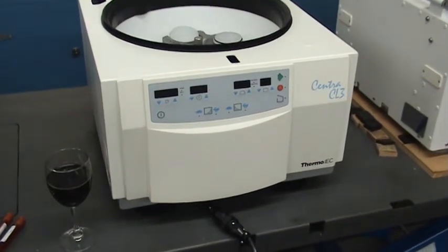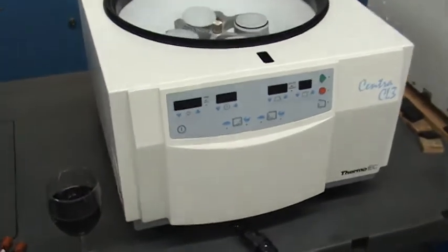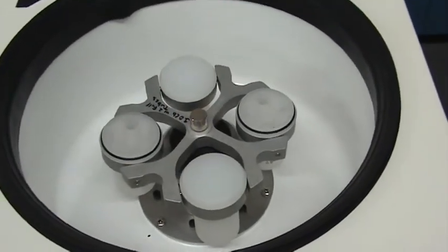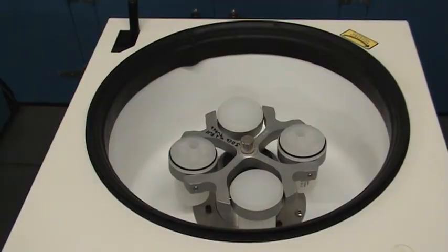For demonstration purposes, we've now installed the Rotor-Mate gyro into the thermo instrument. Some self-balancing centrifuge rotor balancing systems, such as those that use ball bearings in a hollow tube, actually introduce imbalance when there is none. And we'll first show that this does not happen with the Rotor-Mate system.